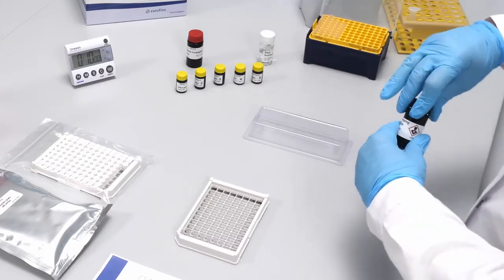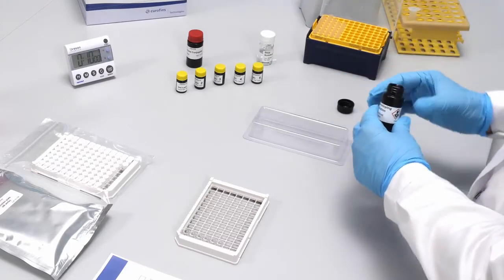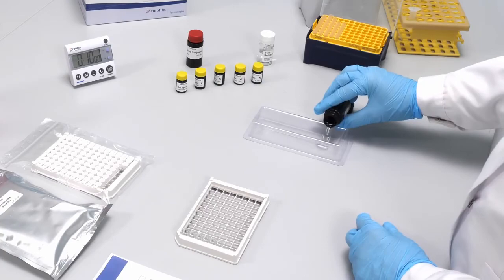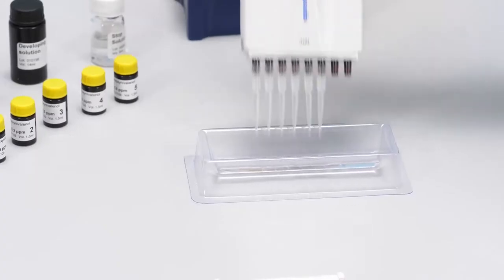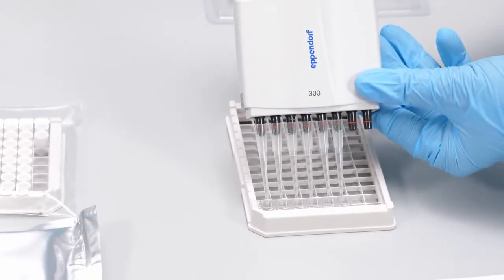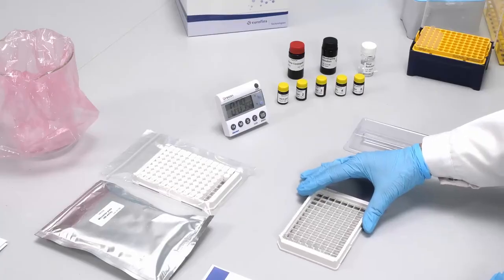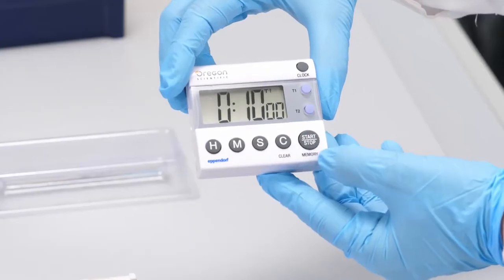Add 100 microliters of developing solution in each well. The solution is colorless and must be protected from direct light. Incubate the assay for 10 minutes at room temperature.